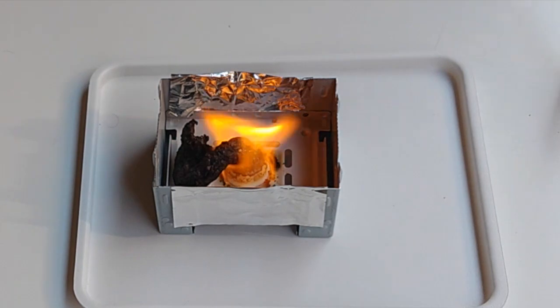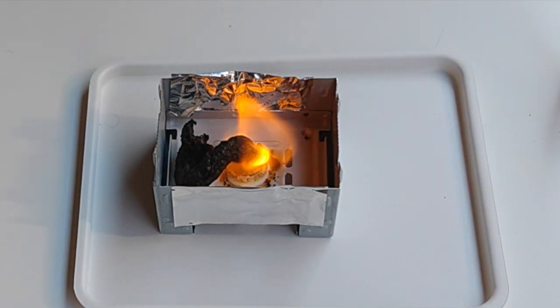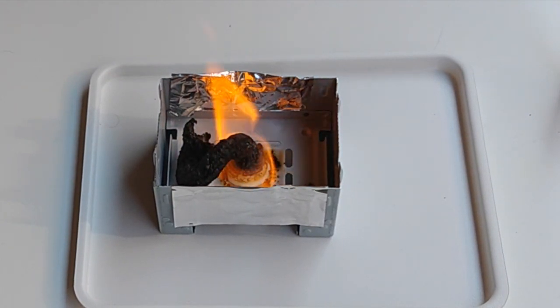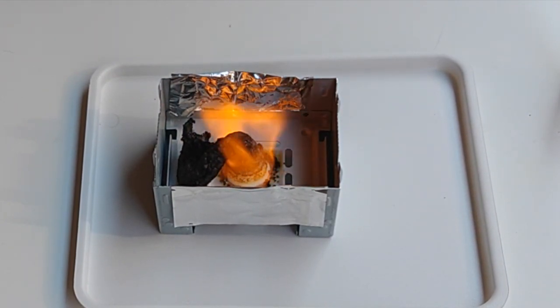Look how big it's getting. Although I don't really see the snake part. It's a long tube, Toby. Yes. I see that. That's all it is. A big tube.